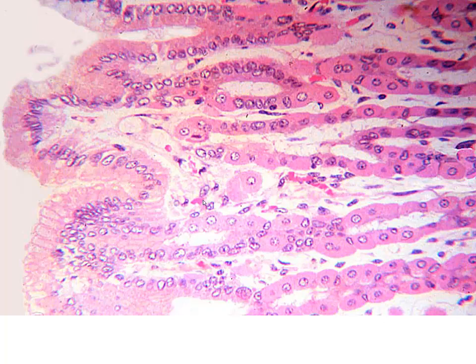Now we've turned this on the side, so a little bit different orientation than we're accustomed to. Here we have our surface lining cells, and these are going to be the ones that produce the visible mucus. This is the one that protects our cells from degradation against the hydrochloric acid. These are going to go into the neck cells, which are again mostly our lining cells that are present. And then as we get deeper, we're going to see these larger cells, and these are going to be more of the parietal type cells that are producing our hydrochloric acid.